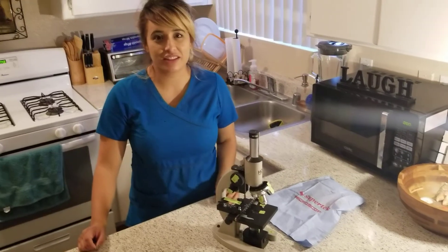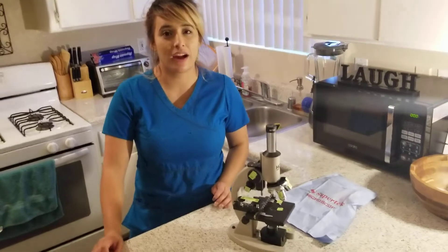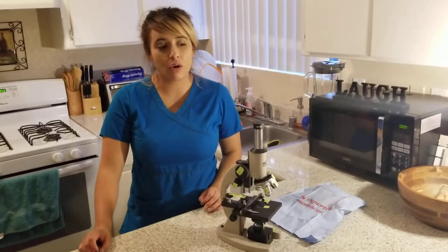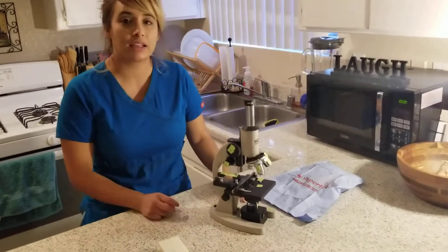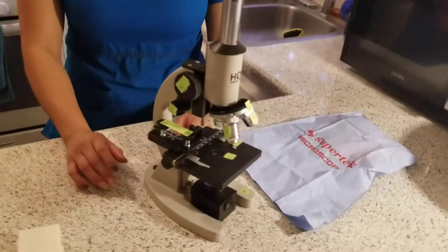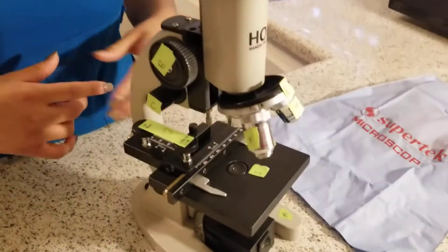Hi, my name is Alicia Cota. This is week three of Bio 225. Today's date is 5-22-2018. Today's lab is to go over the microscope that we have been provided for the class. The microscope that we've been provided is called a compound microscope. What I'm going to go over is the parts, the main components of the microscope.